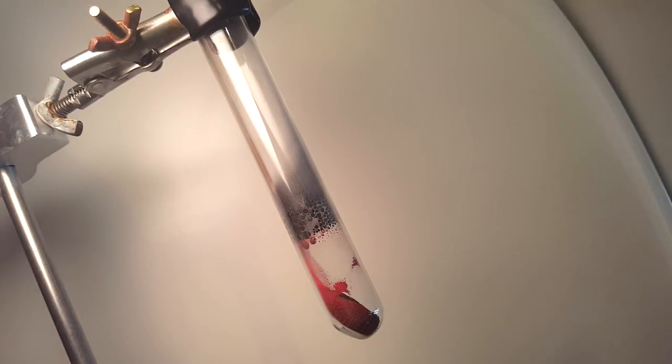When I was admiring the bits of mercury metal, I was completely oblivious to the color changing of the black powder at the bottom of the tube. Over time, as you can see in this shot, it changed back to its original red color. I tried heating up the mercuric oxide again to see if I would get the same result, and I did.